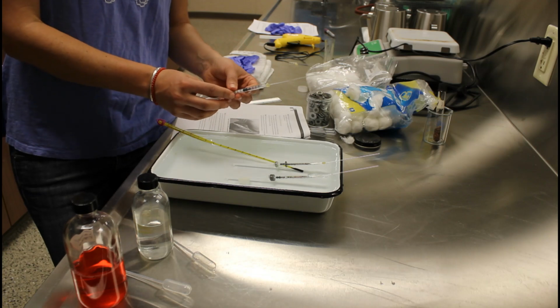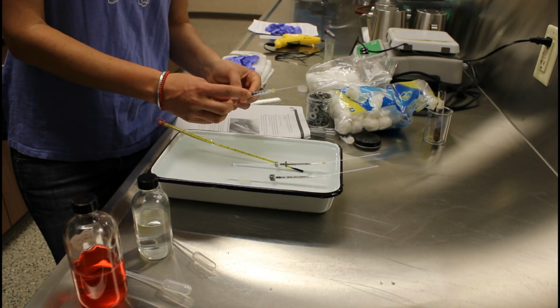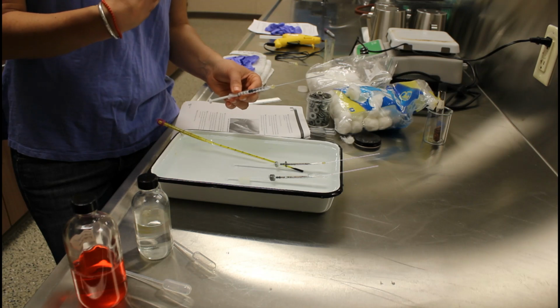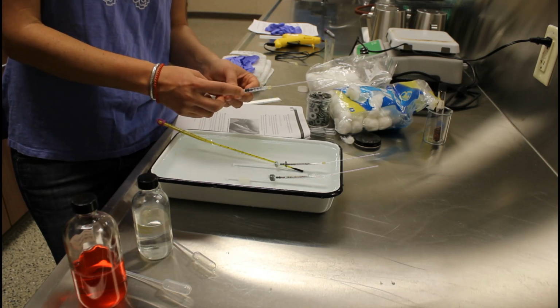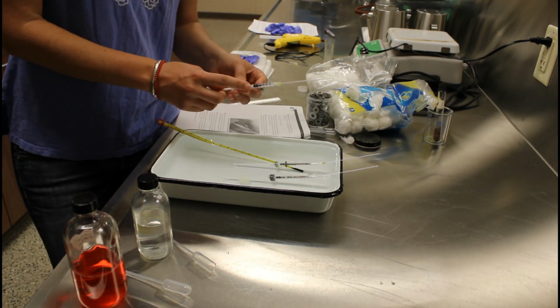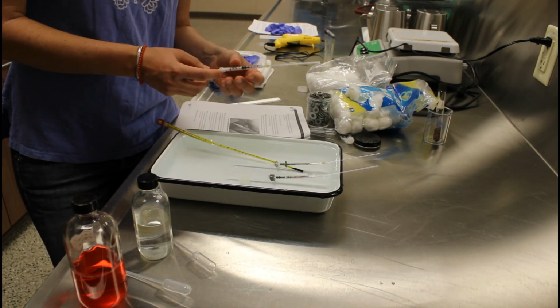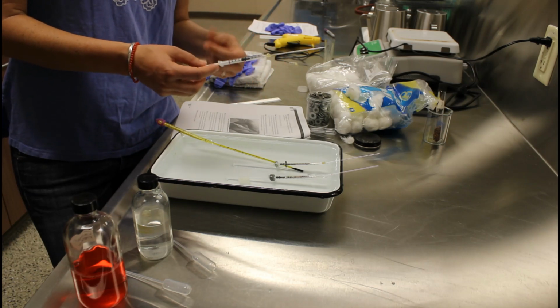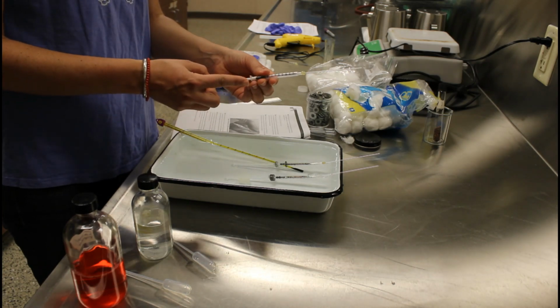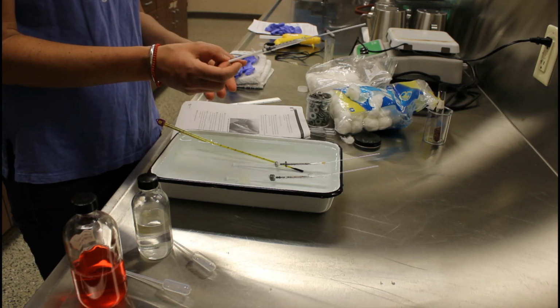So remember, cellular respiration is a really crucial metabolic pathway where organisms take in oxygen and they release carbon dioxide and water as a byproduct. That's how they break down the sugars in their food. So we want this to be sealed because the whole point is going to be to measure the amount of oxygen that's being burned up or utilized by the organisms that we're going to test in this micro respirometer. So I think we're good. We have a seal here.